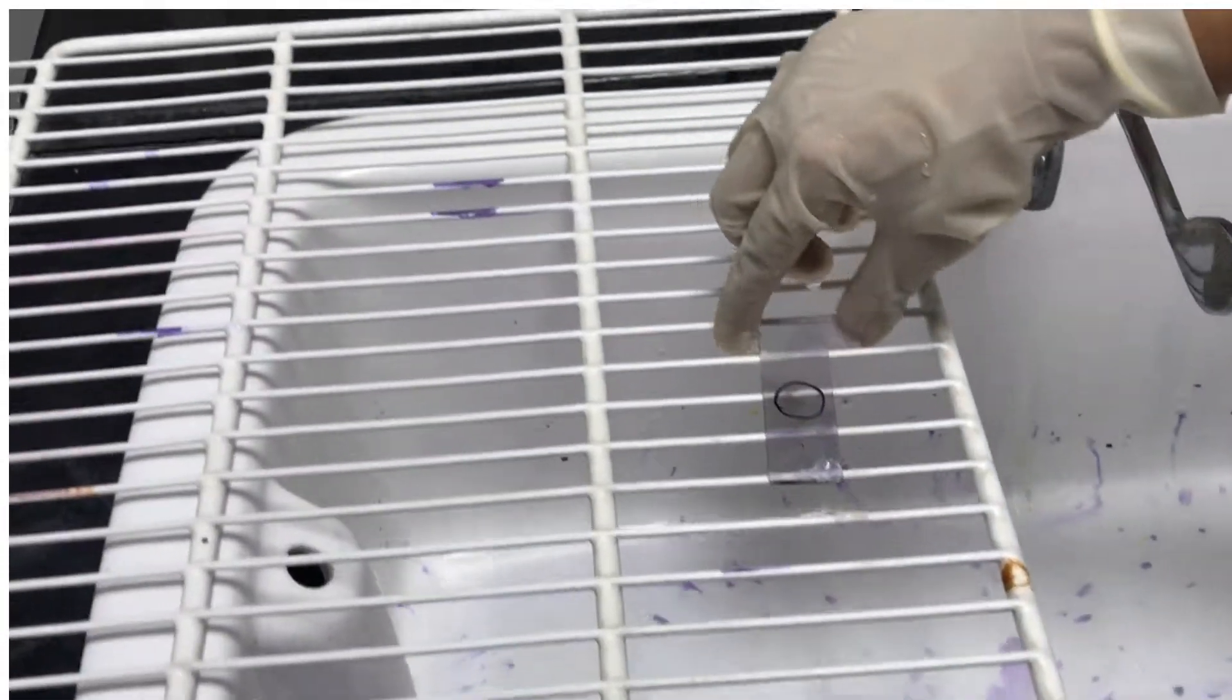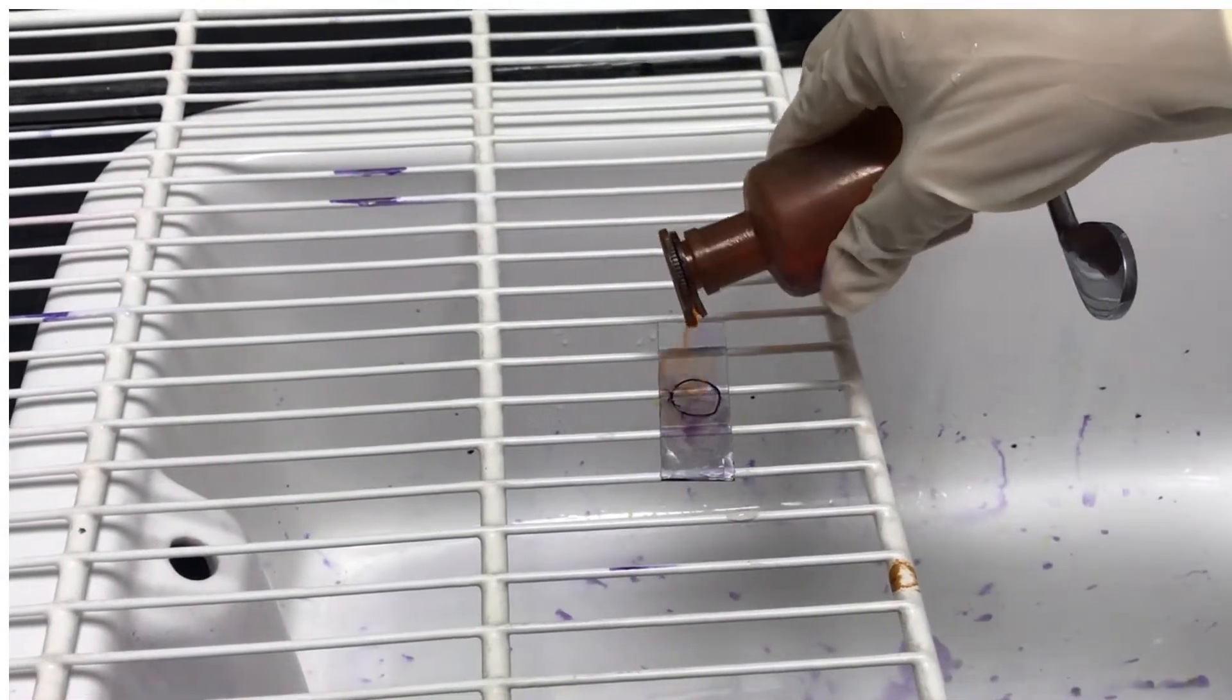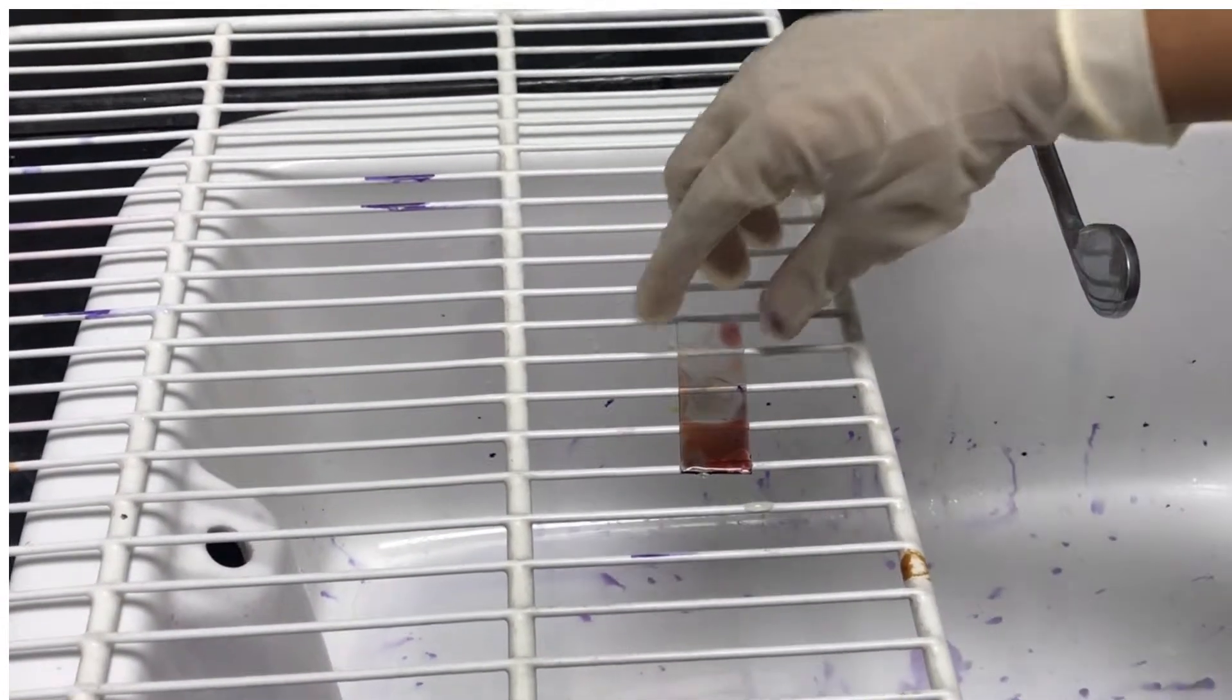The third and most crucial step is to add a few drops of acetone. Let it stand for only a few seconds and immediately rinse with tap water.